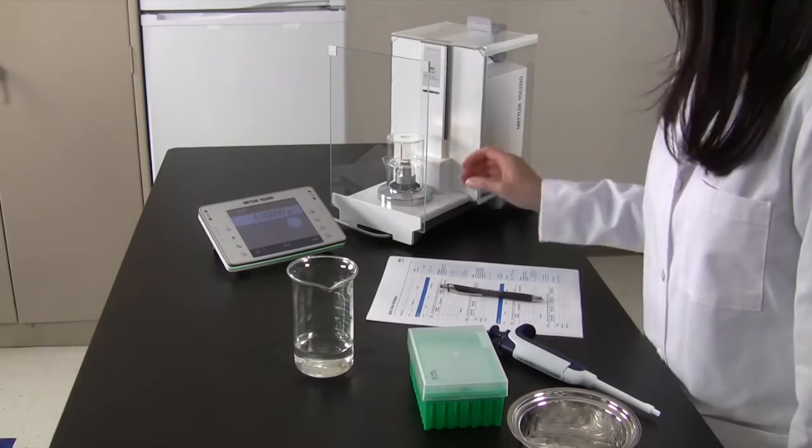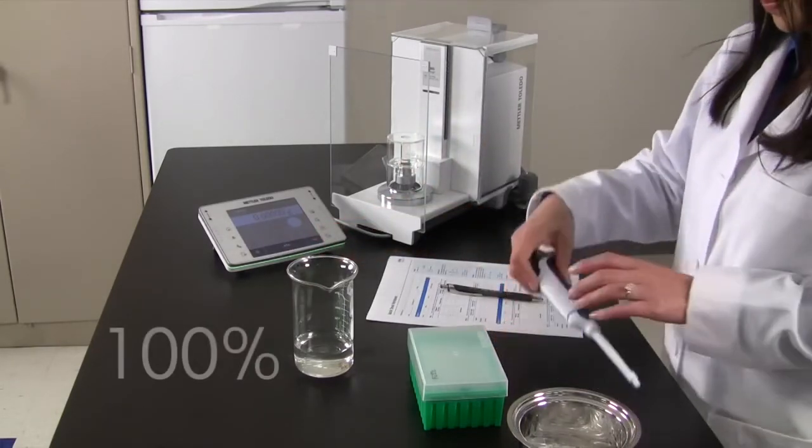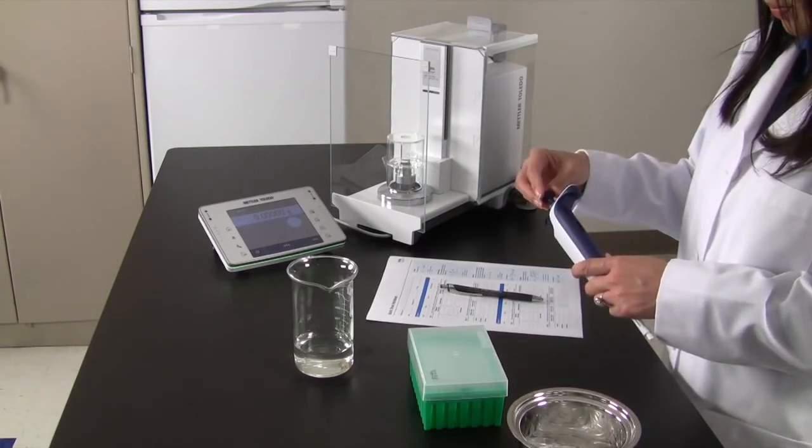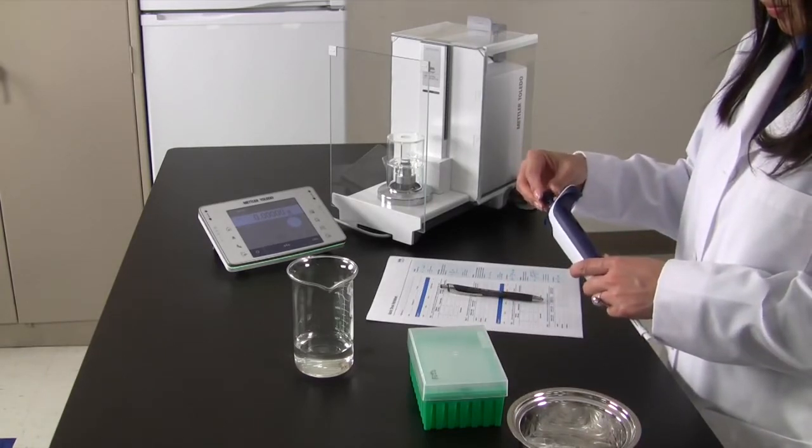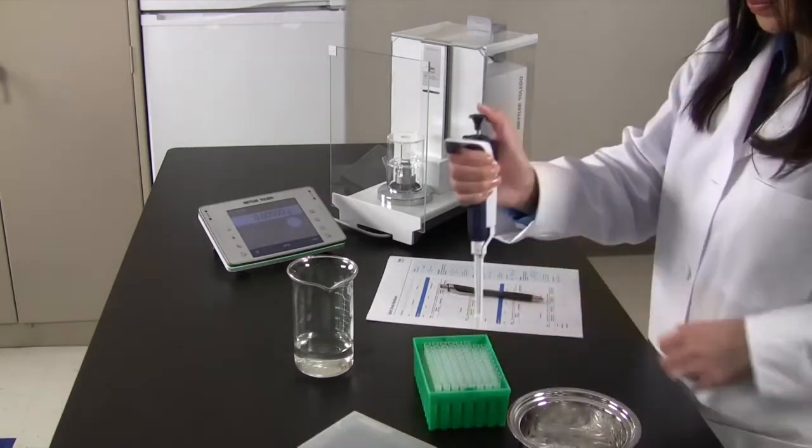First, after preparing the vessel and taring the balance, adjust the pipette to 100% of its nominal volume and load the manufacturer's recommended tip.